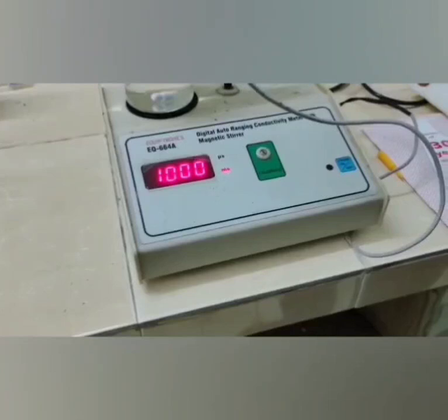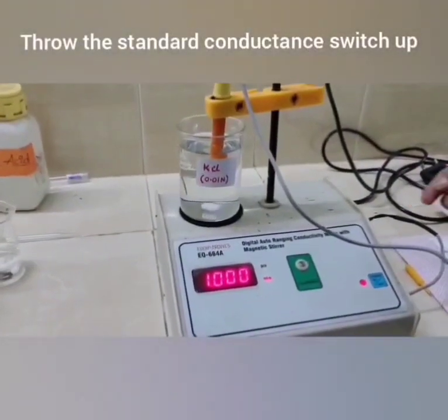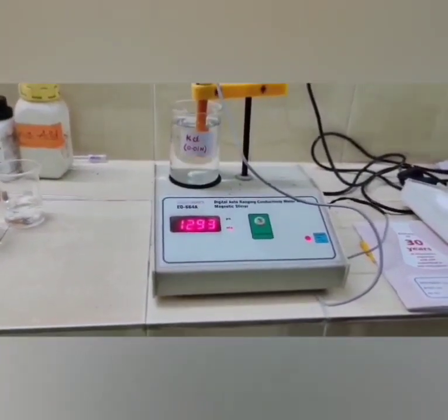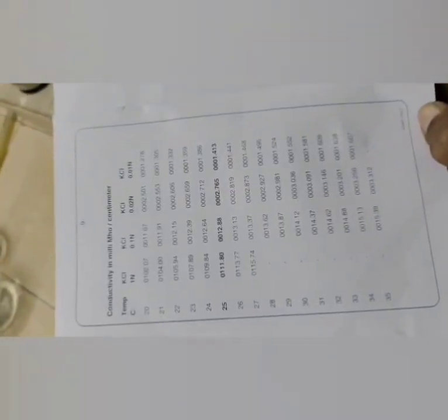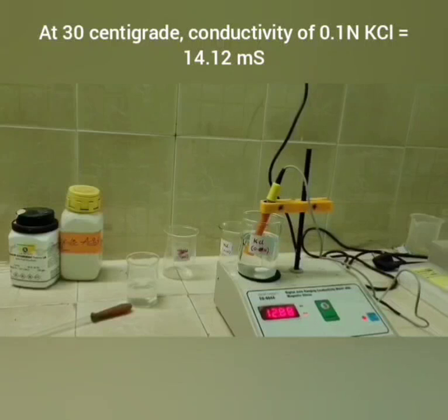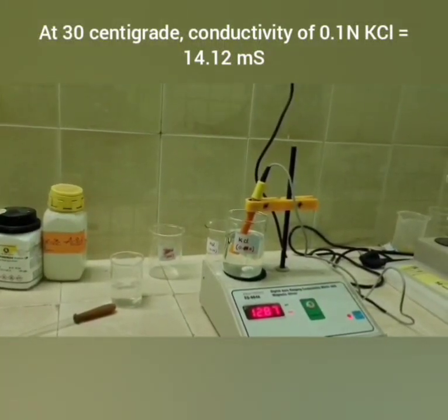Switch on the magnetic stirrer and then throw the standard conductance switch up. We will get the standard conductance values of the KCl solution. Next, we have to measure the temperature of the solution. We are getting 30 degrees centigrade. Here we have the conductance values at different temperatures. At 30 degrees centigrade, the value is 14.12 millisiemen for 0.1 normal KCl solution.